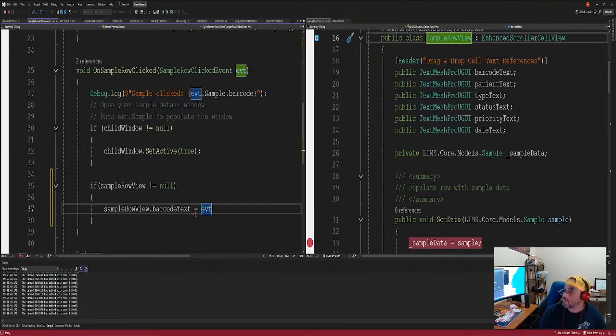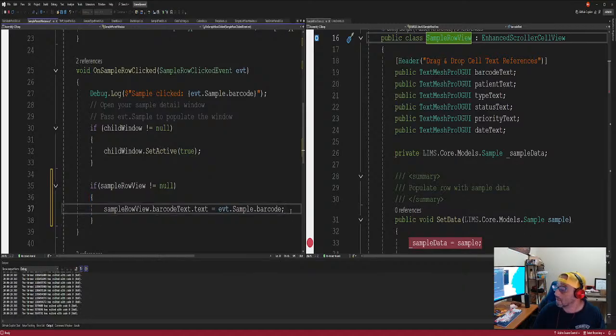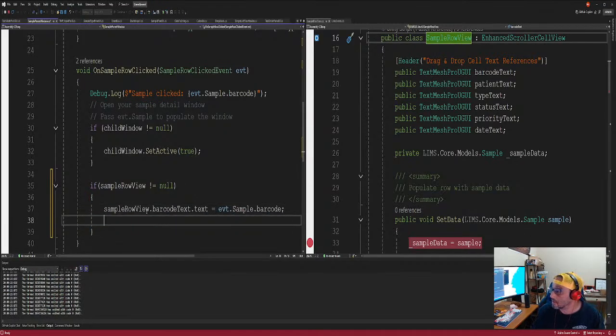I know it seems like we're just passing data from one to the other. Well, that's what it is. Sample barcode, right? Text, right? Am I correct? No. Oh, text, barcode, text. Yeah, correct. Got it. All right. We're making some headway here. But then we need the patient text. Okay, right here. I'm just gonna do this because it's easier.